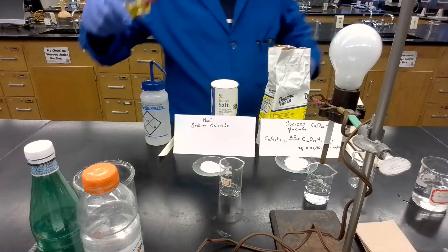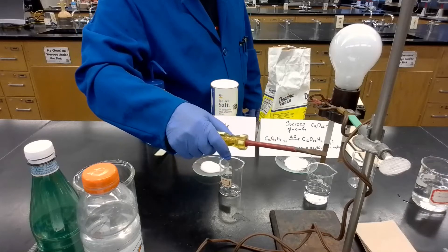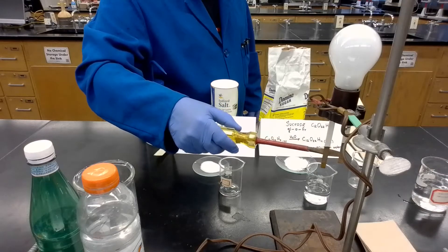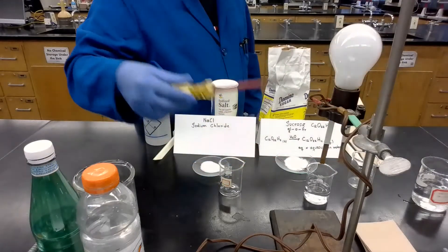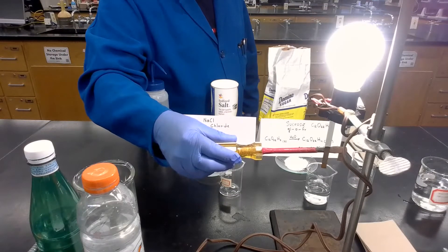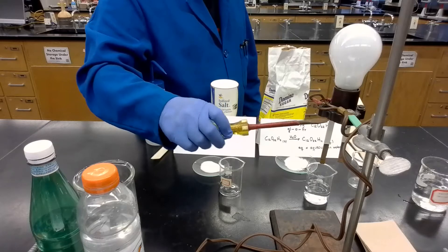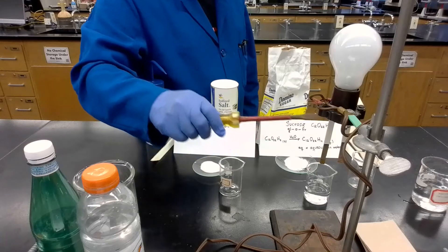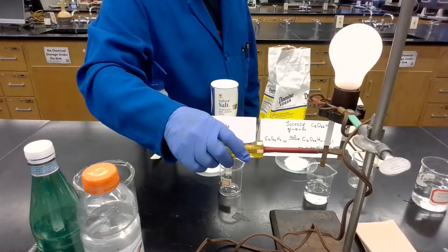I can close the circuit. If I connect this terminal that is connected to the power supply to this terminal, you will see what happens. Now we close the circuit. How do I close the circuit? Because I'm putting a metal — I'm connecting the two terminals with a metal. Metals are good conductors of electricity. So we just need to close this circuit to see the light come on.